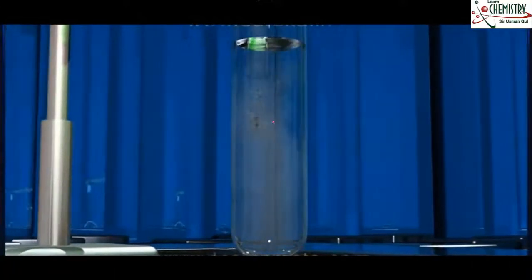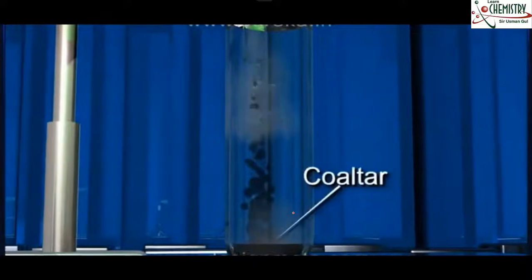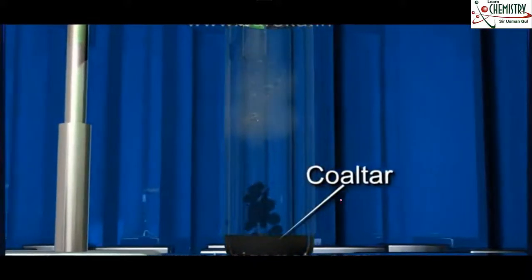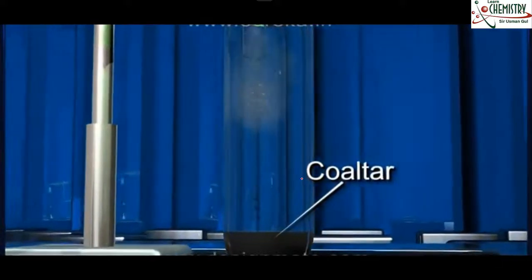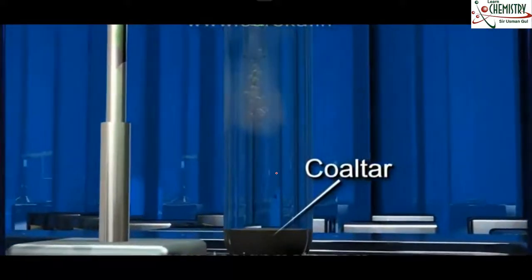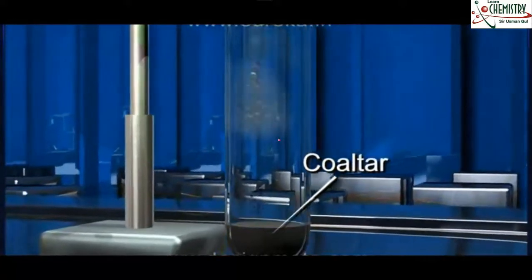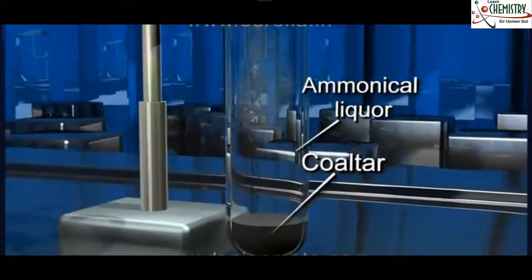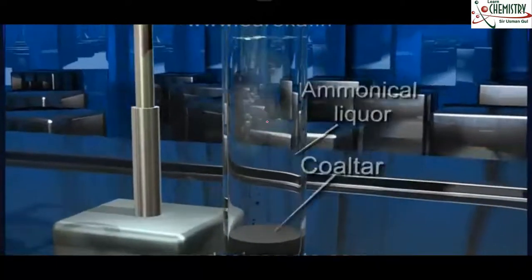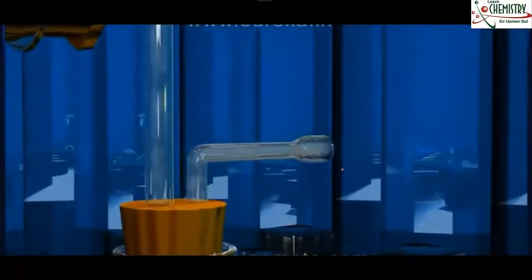Okay, they start condensing. The heaviest part we get is coal tar. Basically the heaviest condensed part is called coal tar, and some part of these vapors gets dissolved inside this water, and this part is known as ammoniacal liquor. And the third part, which is not soluble in that water, comes out in the form of gas. We call this gas coal gas.